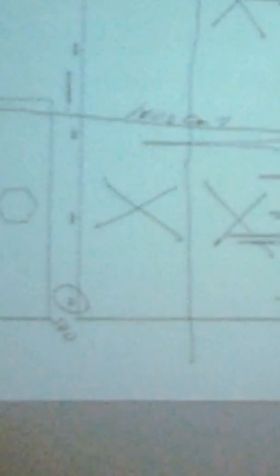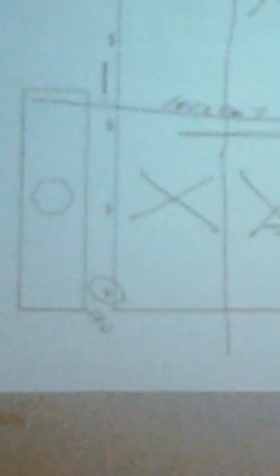I'm going to ignore this quadrant and this quadrant. But for all but one assignment, you're also going to ignore this quadrant. So the highlight is the lower left quadrant. Any peak that drops below 50% and is between 4,000 and 1,600, you're going to pay very serious attention to.